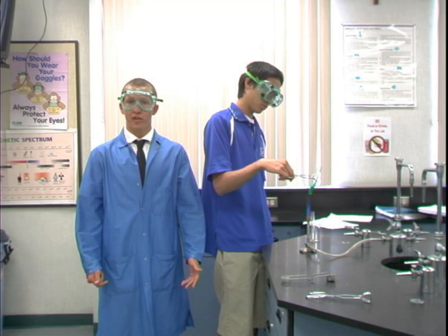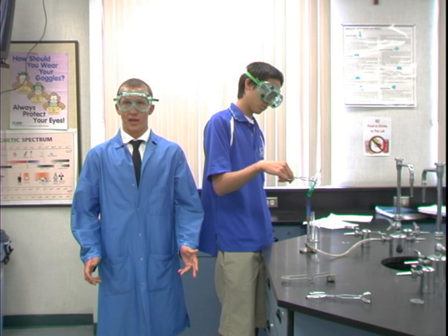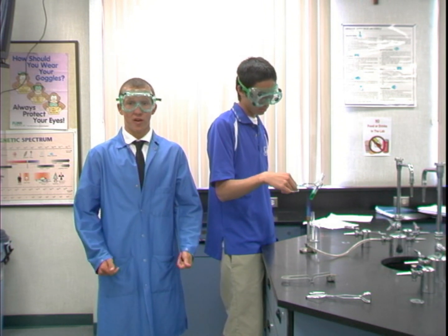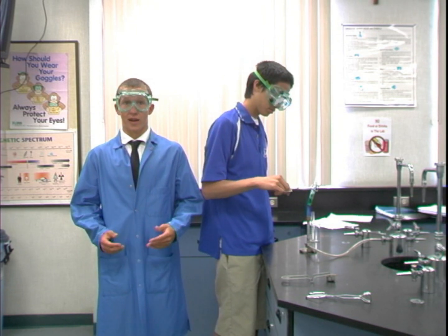From my experience in the lab, I've seen a lot of injuries brought about by flames and heat. Hot things are often referred to as the silent killer because you cannot tell the difference between a glass heated and a glass at room temperature. There are some fire and heat safety tips that I should also tell you.